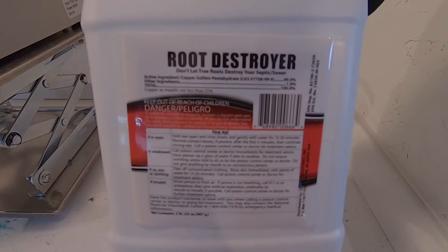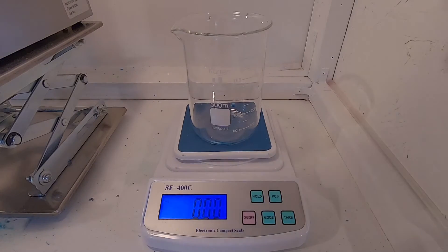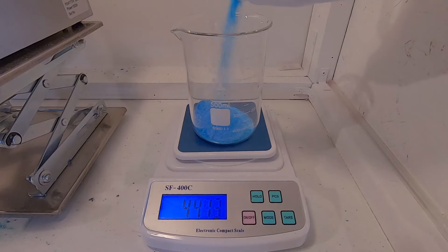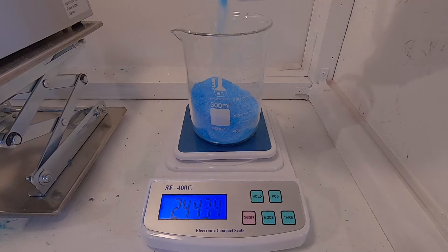Hello fellow alchemists. Today I will be recrystallizing copper sulfate pentahydrate to increase its purity. I am using OTC root killer, which claims 99%, but I don't believe it.